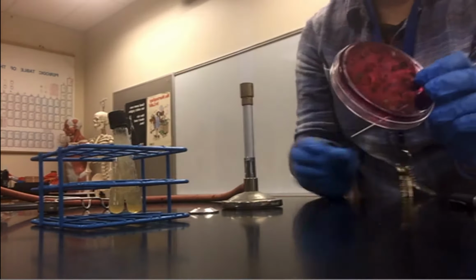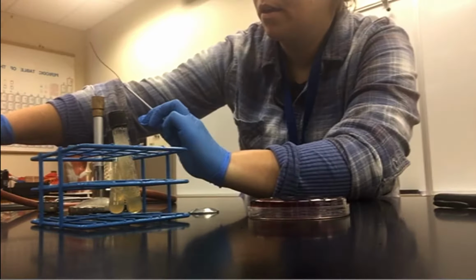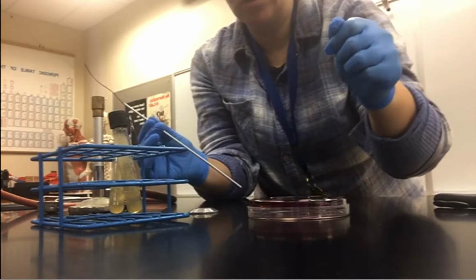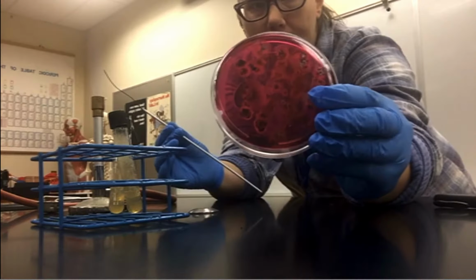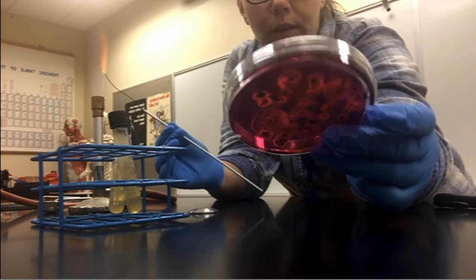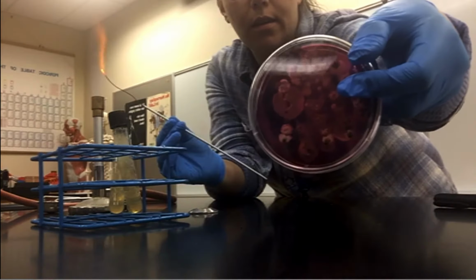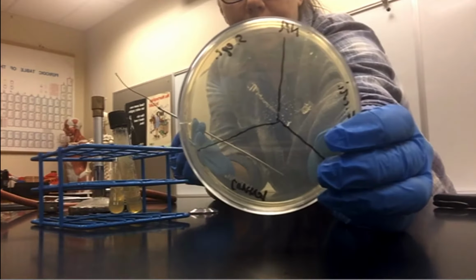Okay. Next, you would do the exact same thing for your EMB plate, and I'm not going to run you through that. It's the exact same process. Zig and a zag and a little stab to get under the surface. The only difference is that your EMB plate is really pink. Right? And so this isn't going to be what yours looks like. This is for a different lab from soil. But you're going to set it up the same way with the trisections.